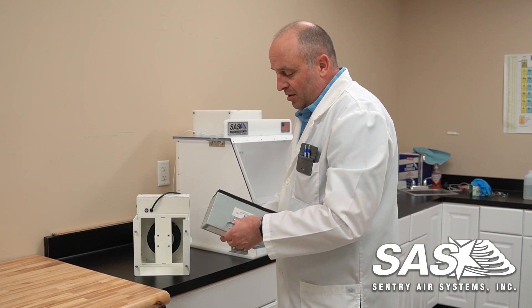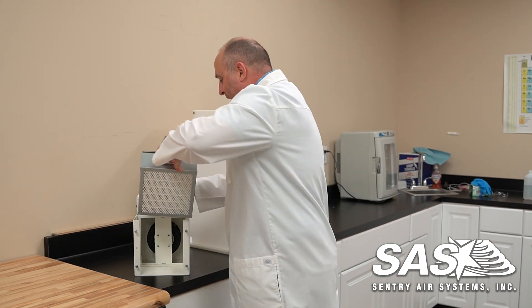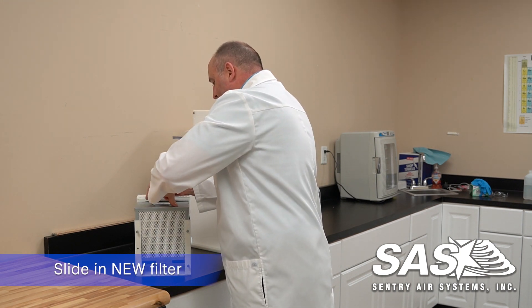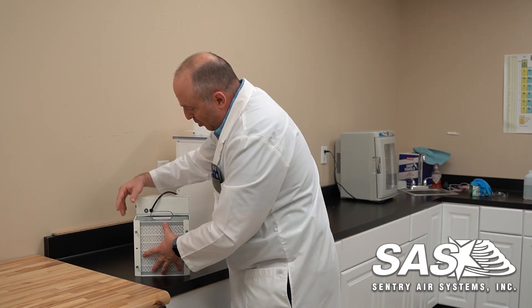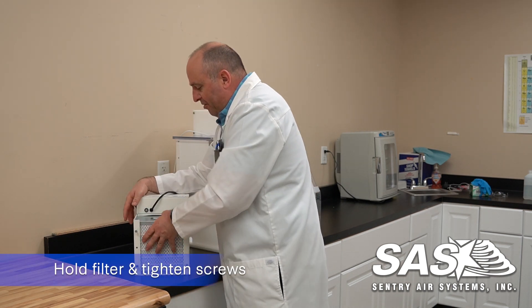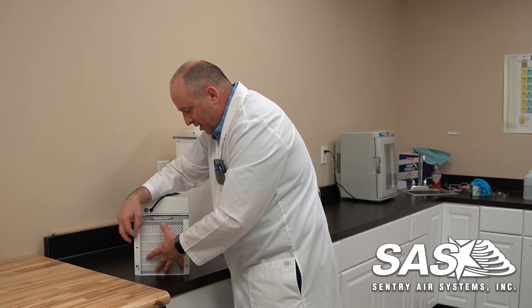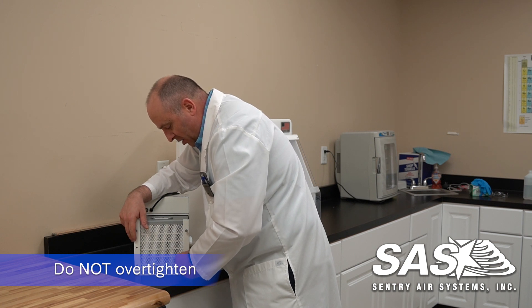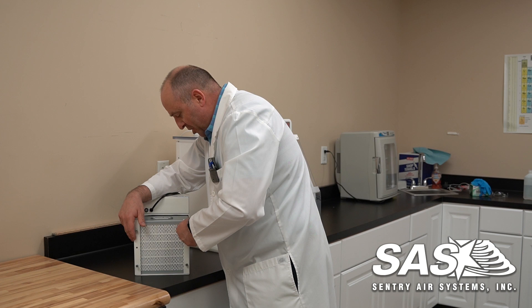To replace this, lift the handle up here, hold the power cable back a little bit, and slide it right back in. From here you're going to put a little pressure on the filter up against the flange and you can start tightening up the thumbscrews. With these thumbscrews you don't want to put them too tight — just snug. You don't have to over-tighten them, just enough to create some pressure with the gasket.